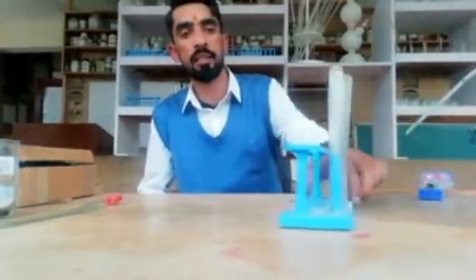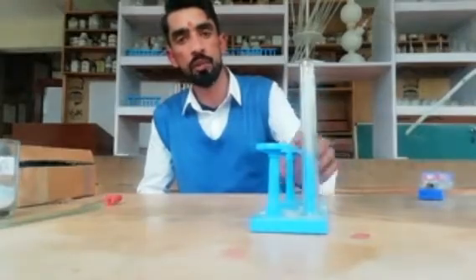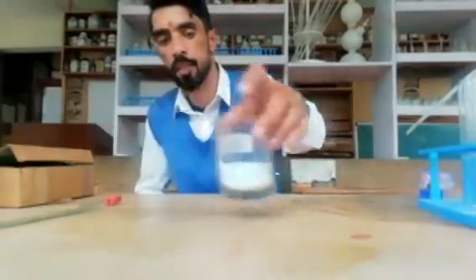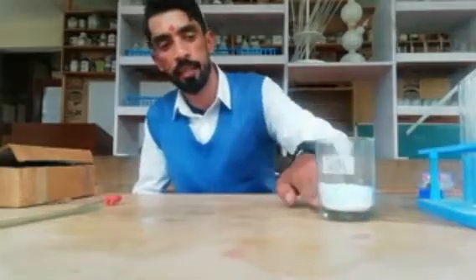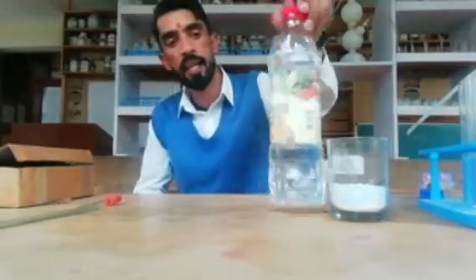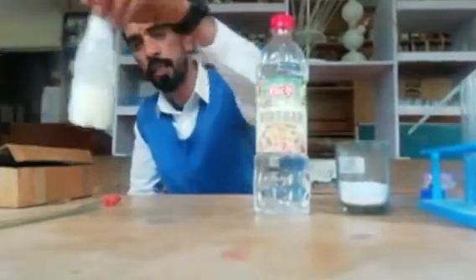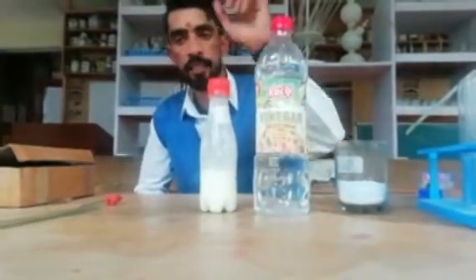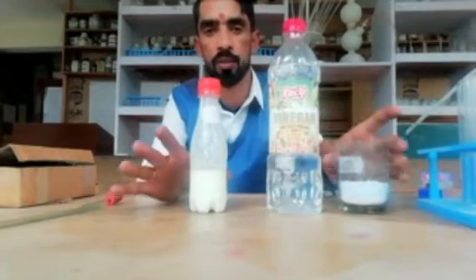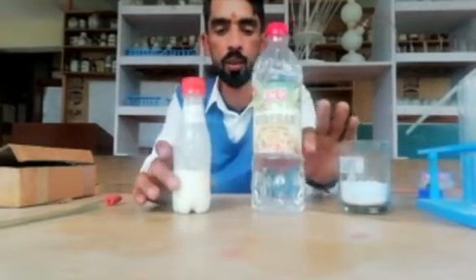For that purpose, you need some things like test tubes and a test tube stand. We have some samples here: washing soda as a base, vinegar which we use in our daily diet as an acid, and curd which is also an acid. These are some of the organic acids and bases which we use at home in the kitchen.